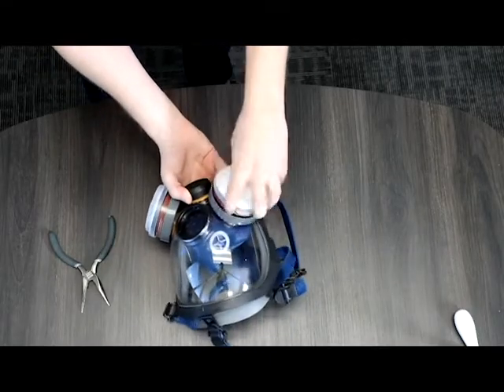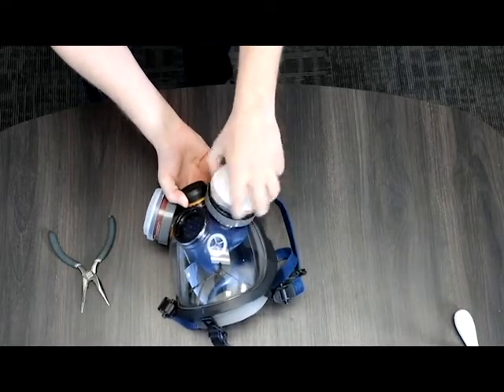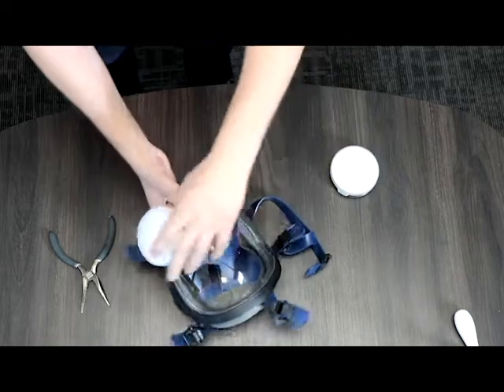First we're going to start by removing the PA1 threaded filter. You turn it counterclockwise.